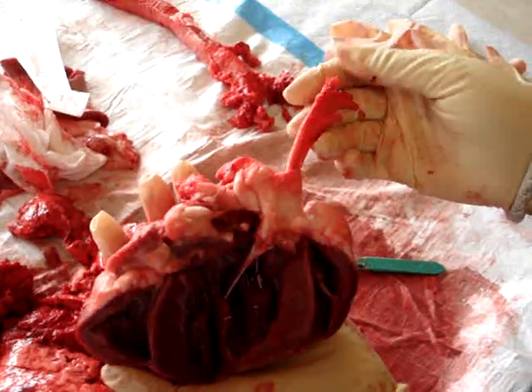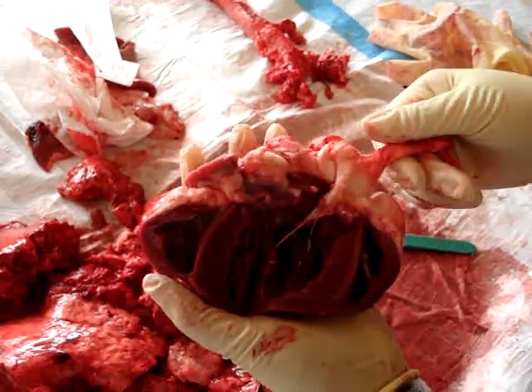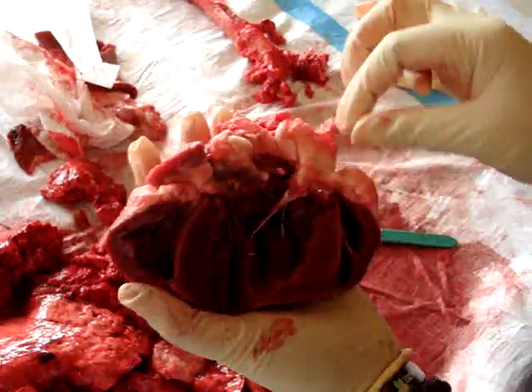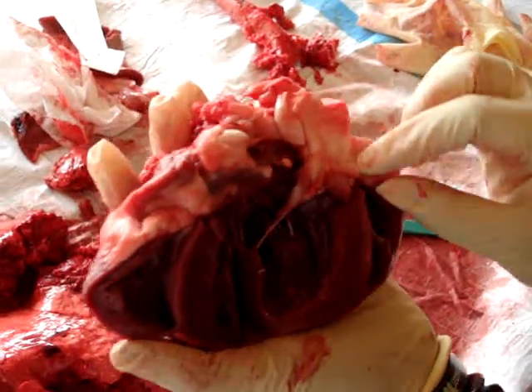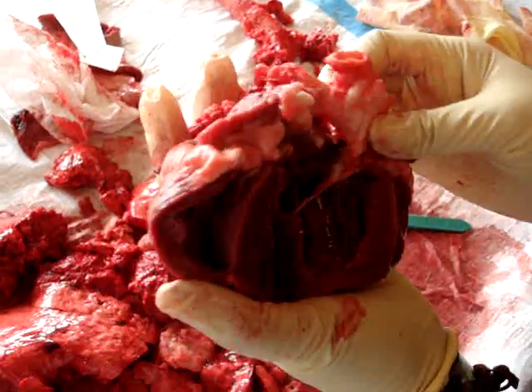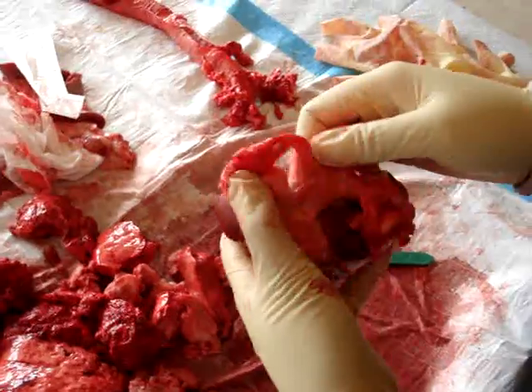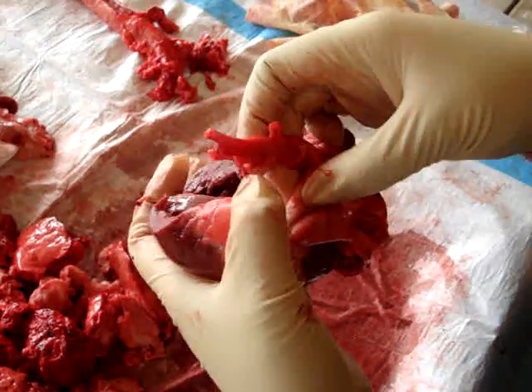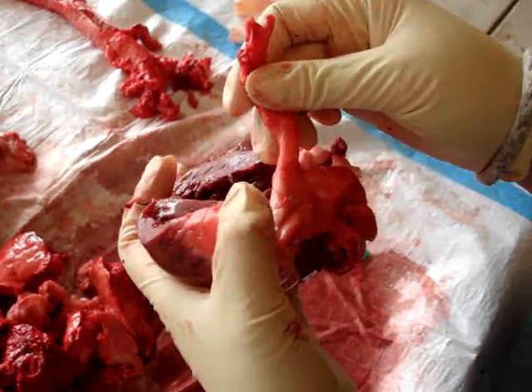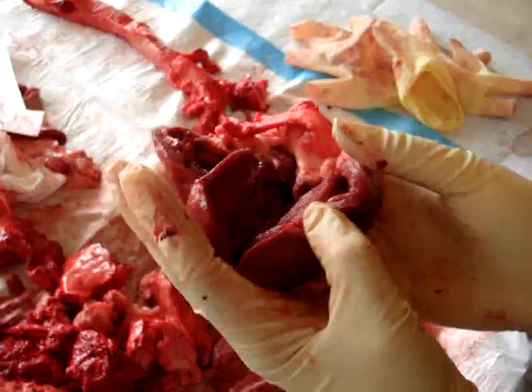Your brachiocephalic, common carotid, and right subclavian. Your coronary arteries should also be here somewhere, but I haven't found them yet — I will in due time.